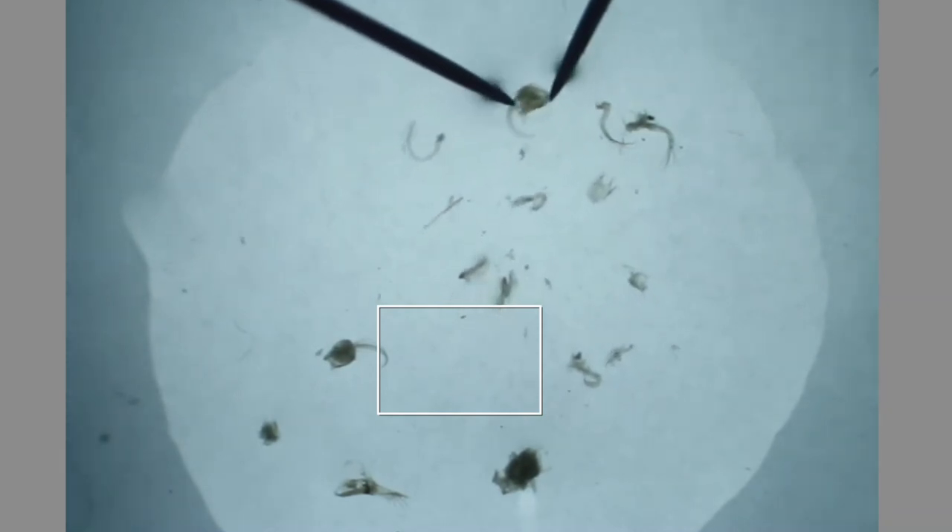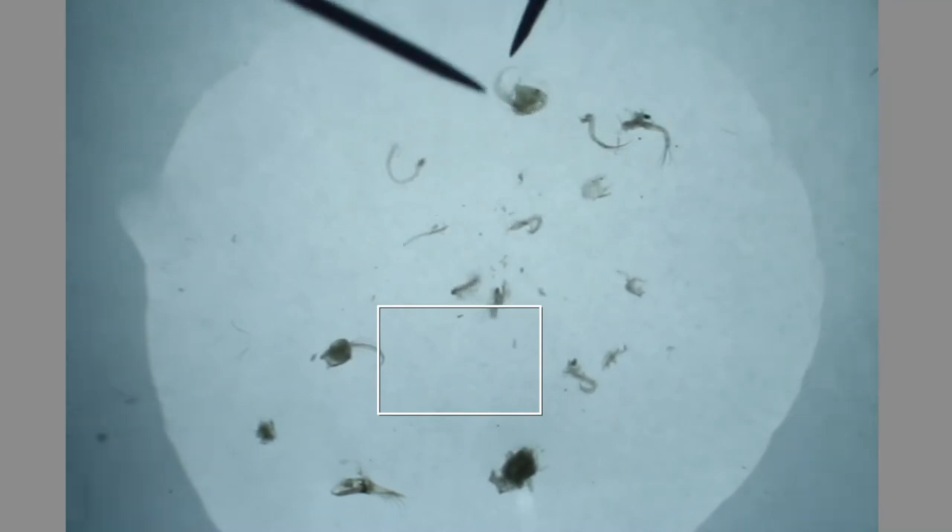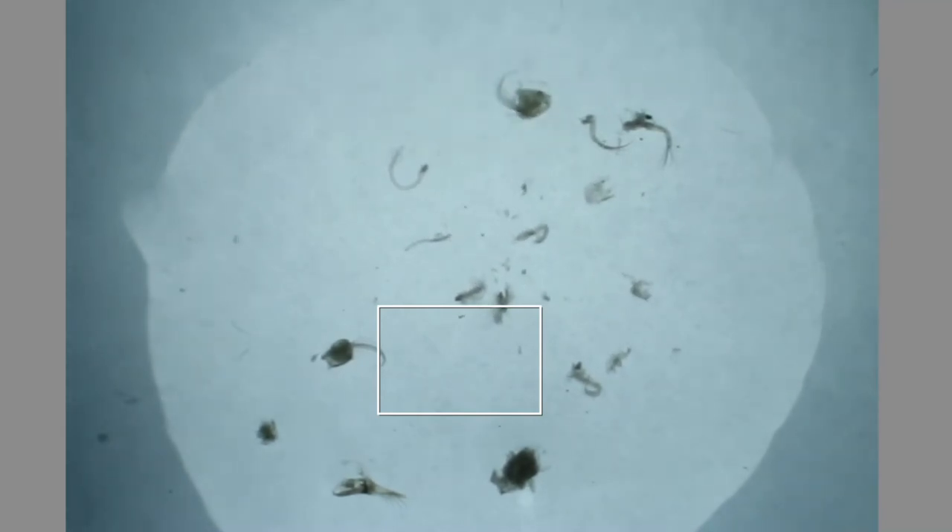For example, the second antenna I think will be happier for me to look at this way, so I'm going to flip that one over. You'll get a better picture of that — the more of these pictures that you look at, the better you'll understand the orientation.